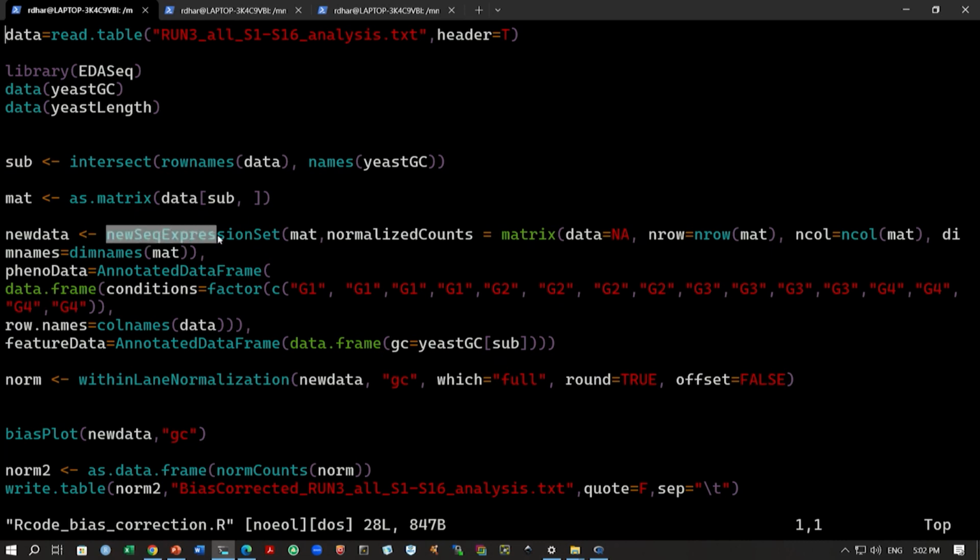Now we are ready to create this new seq expression set. Again, it might seem a bit complicated, but we are following the manual, exactly what is given in the manual. So we will create this new data variable and assign the new seq expression set that we create into this variable. The first part here is the mat, the matrix that we have just created, which is only the count data.